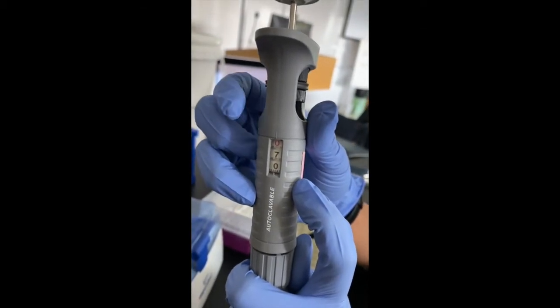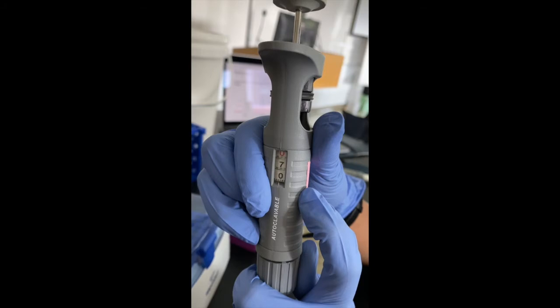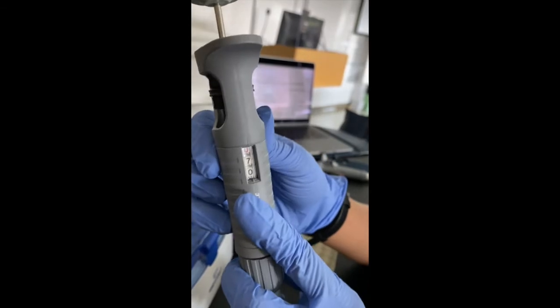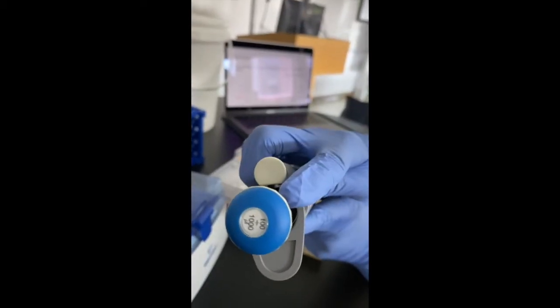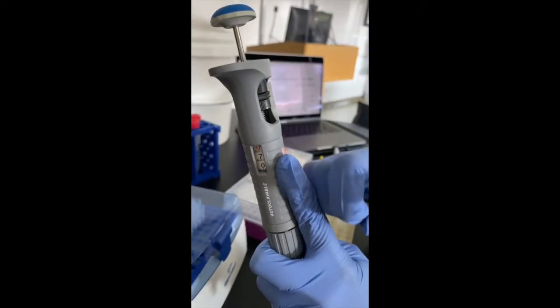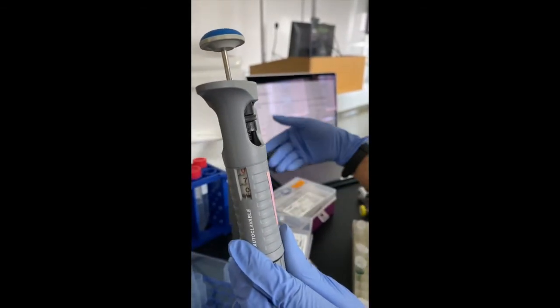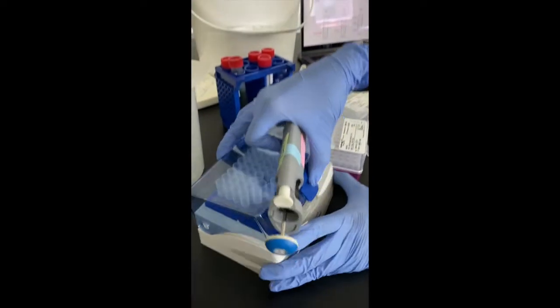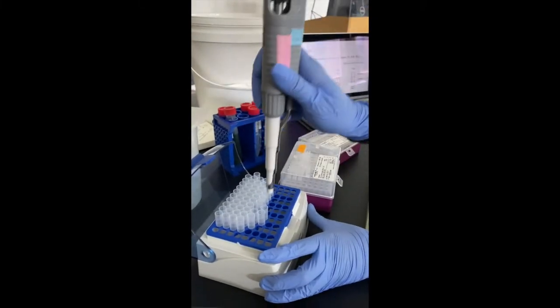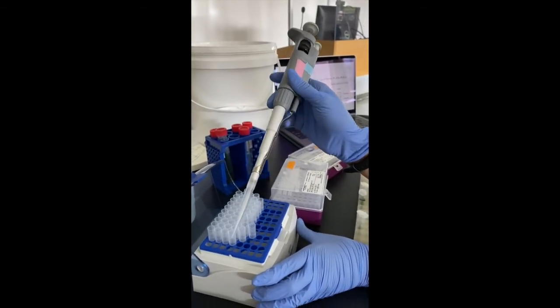The first digit can only be set to 1, and that's only being set to measure a volume of 1000 microliters, for which the window has to display 100. Remember that when you choose a micropipette and see the range, please do not set the indicator window to any volume above or below the range that it can measure. The next step is to choose the appropriate set of tips, and for P1000 it's the largest set of tips available. So once you've identified the appropriate tips, insert the micropipette, apply slight pressure, and you've inserted the tip into the micropipette.